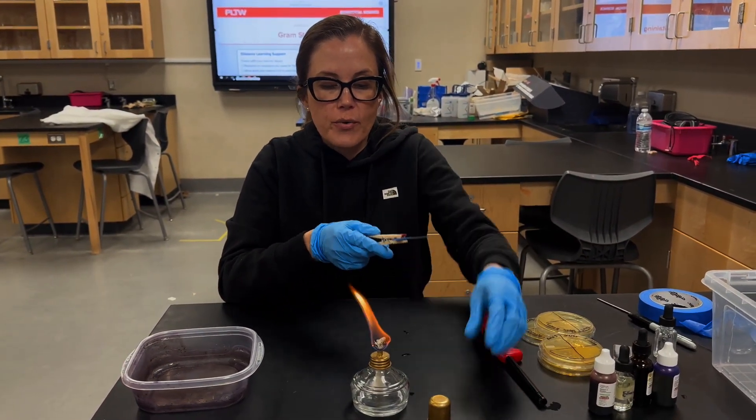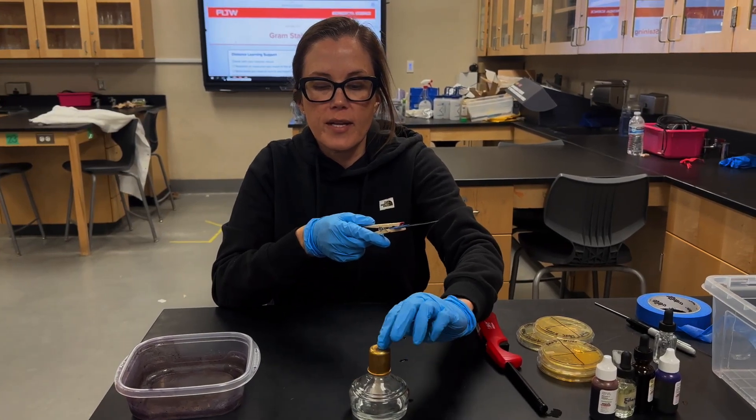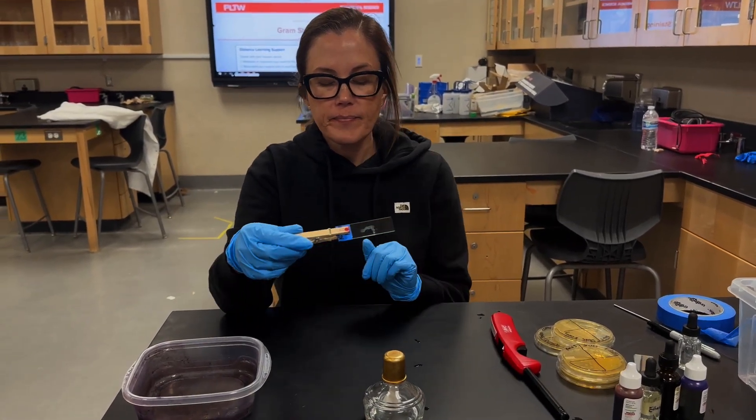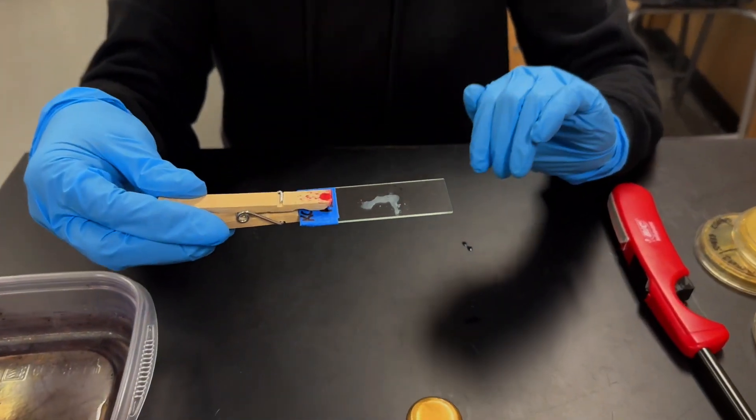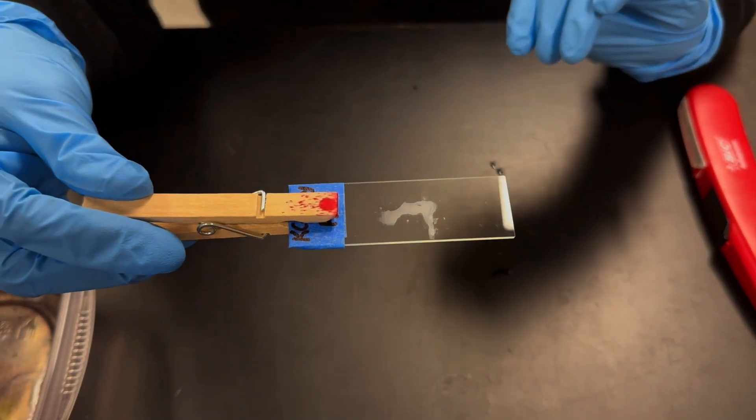When you're finished, you're going to just extinguish the flame. We don't need it anymore. And what's happened during this step is we've fixed the bacteria to the slide so that it doesn't rinse off during the rest of the process.